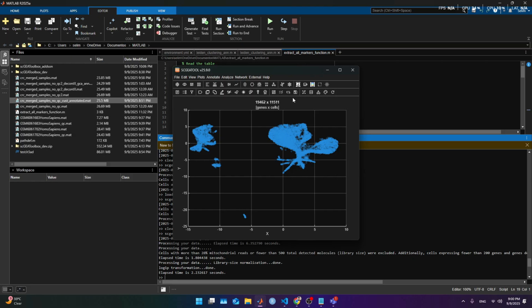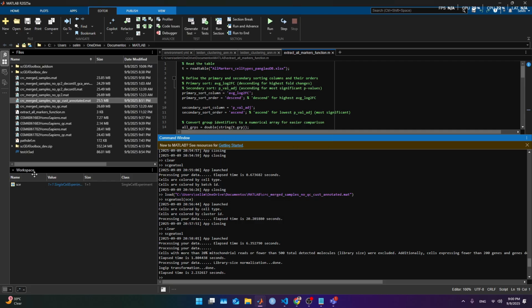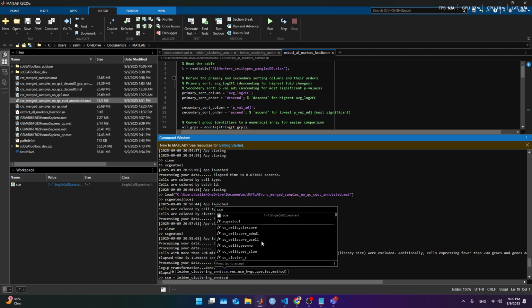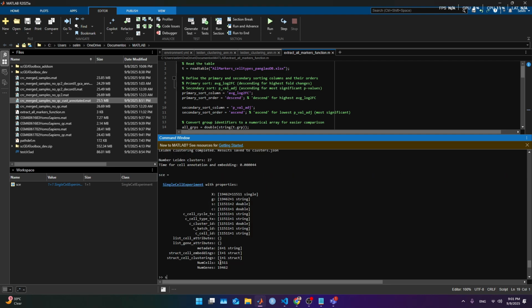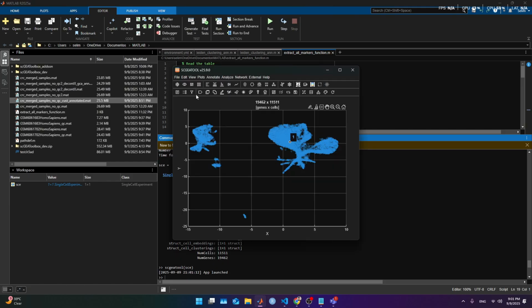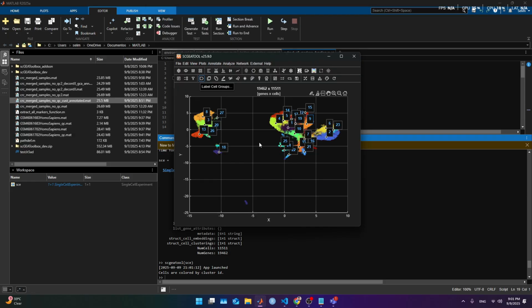And the second thing I'm gonna do is save that into the workspace. Save the sce, and it should show in the workspace. And I'm gonna do the Leiden clustering, sce, and the resolution of 2. Gonna hit on it and come back when finished. Okay, it finished, and we have the object, so we load it. And if I get the cluster ID, it should have the numbers. Okay, it gets it.